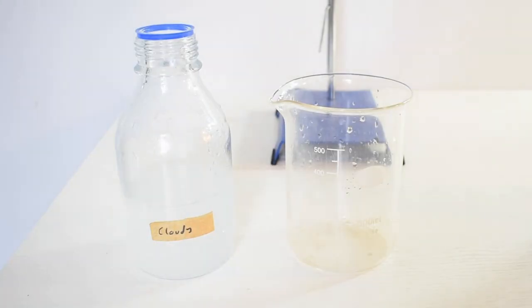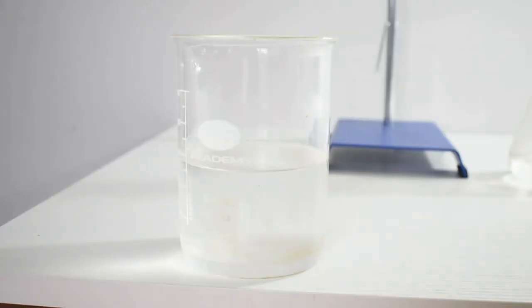The washing steps are repeated about five times until the distillate becomes significantly clearer. You can tell that the distillate is a lot clearer now, so I'm just going to do one final washing, and then we will separate our product from the dichloromethane.